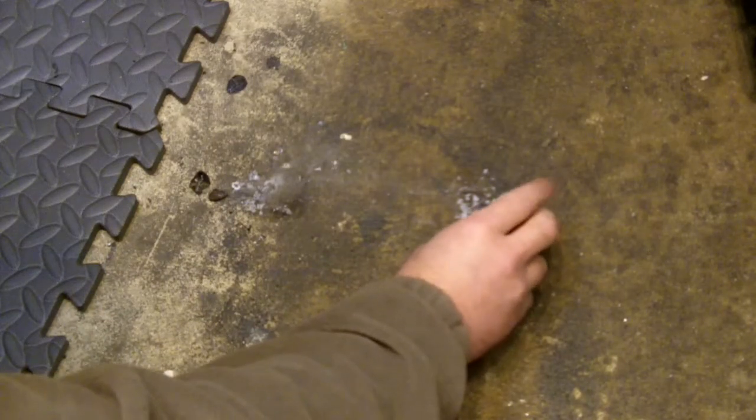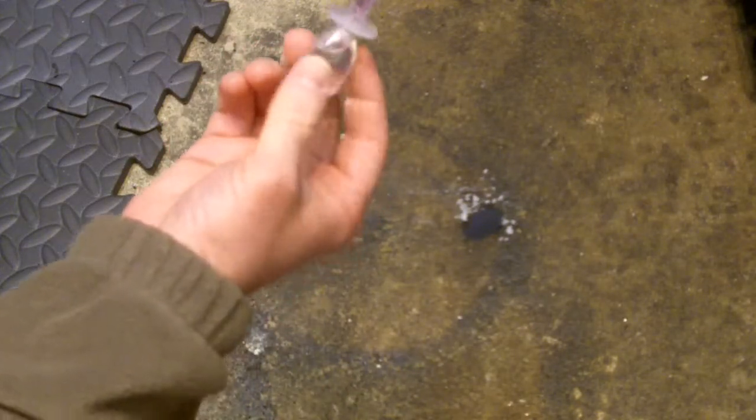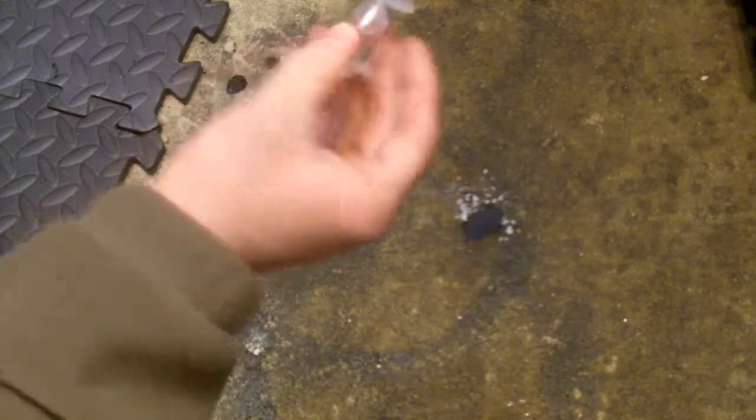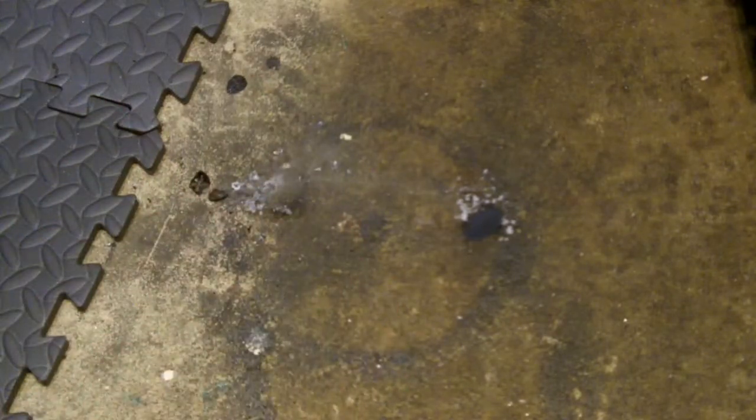Okay, this is potassium permanganate and this is glycerin. You can get this at the drugstore. It's a sort of suppository laxative. You can also buy it by the bottle, but this comes in a handy-dandy applicator.